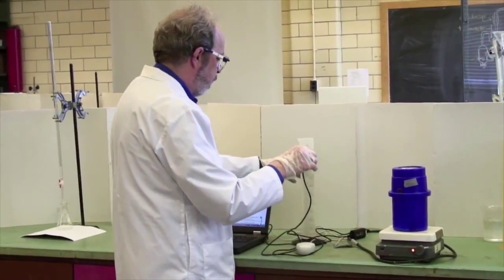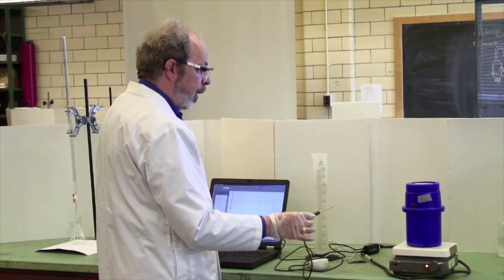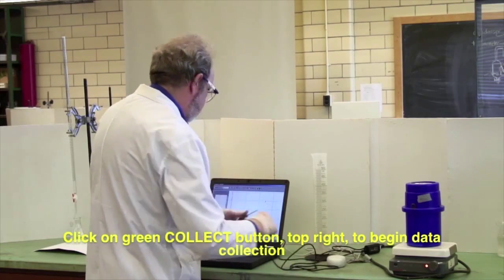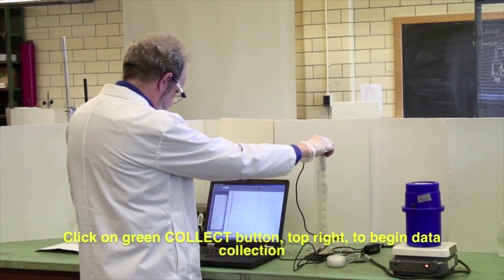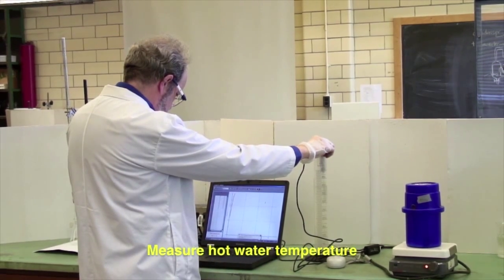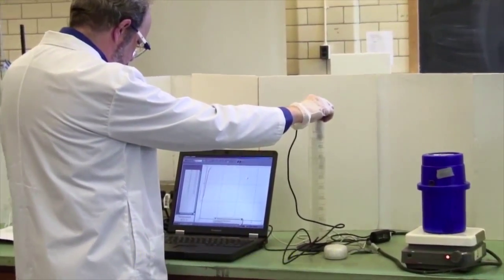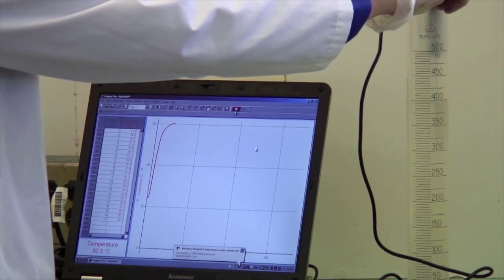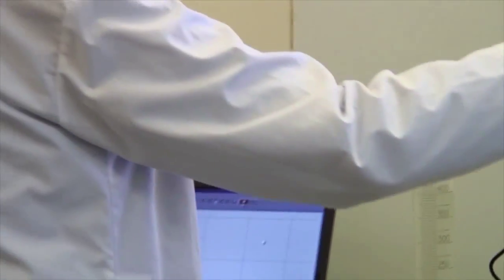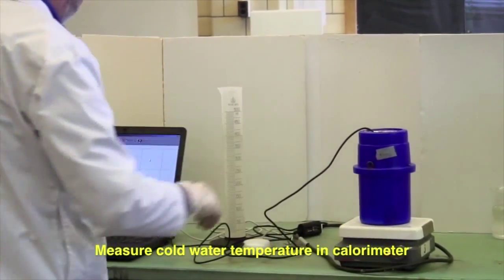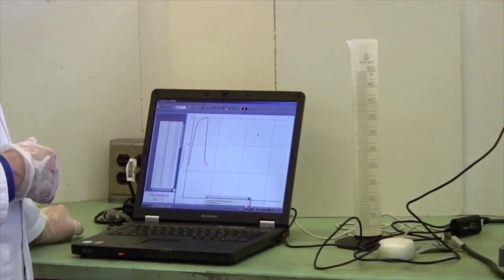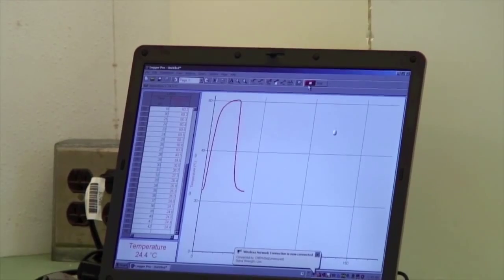So, to start off, I need to know how warm this is. And then I will measure how cold that is. And then I will pour them in together. This starts off by, where is my cursor? Collect. And the high temperature. You hold it here until you're pretty sure you've got a steady temperature. 60.3 appears to be pretty close to stable. Put it in the cold water. And this will go down to room temperature. And that's stabilizing at 24.4. Mix the two.